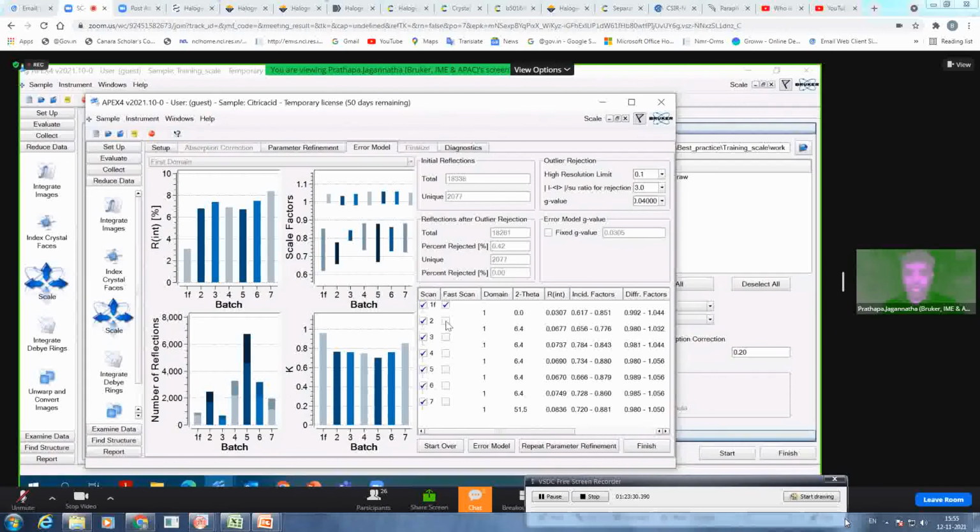And then you see, in this case, the fast scan has been included already. If not, you might see that this will not be ticked like this. So you need to tick and repeat the parameter refinement to consider the overflow reflections. And then here also you get the outlier rejection information. If you think there are too many reflections which have been rejected out of the total number of reflections, then you can try changing these values to get a better error model and then do it. And then finish your scaling.